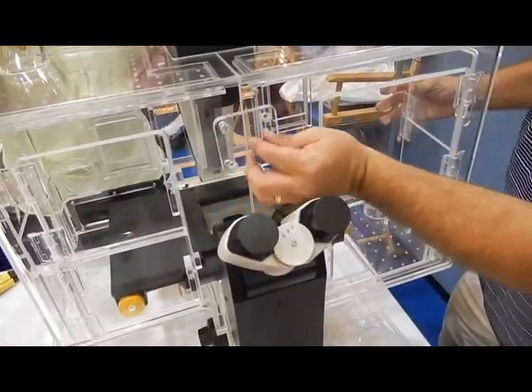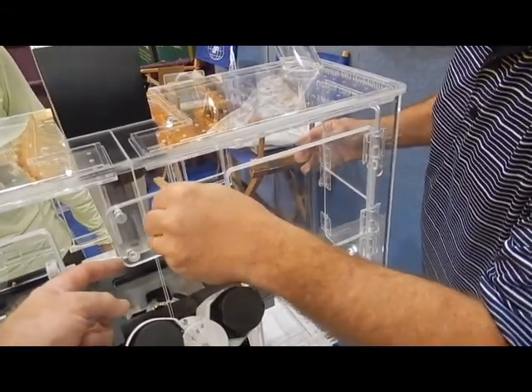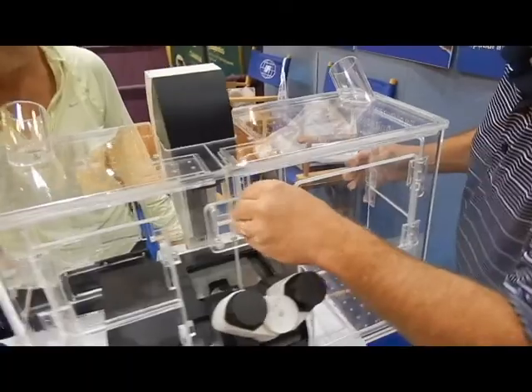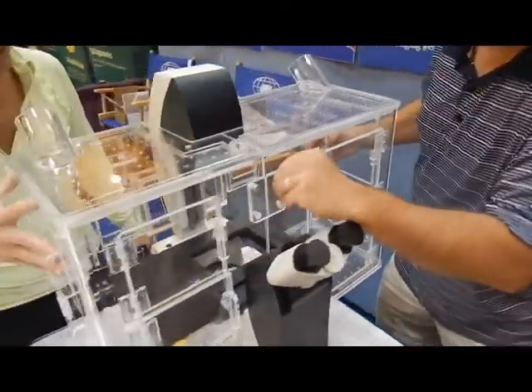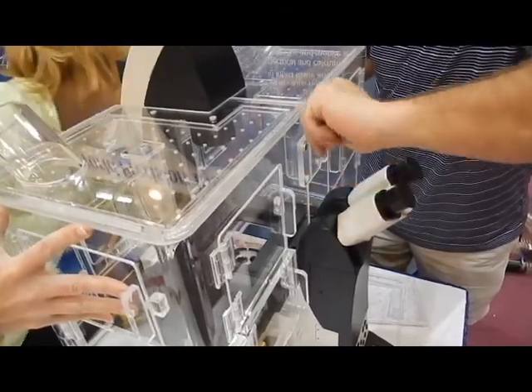While you are holding both sides in place, position the front face plate connector and install a screw on the right side. Do not tighten the screws until all the screws are in place.